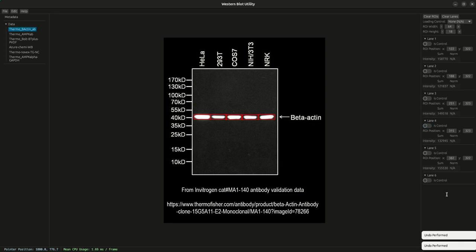And then just to demonstrate that you could right click, remove the lane, it will also remove the ROI. The lane is ultimately a parent for the ROI. So if you remove the lane, it will also remove the ROI. And in this case, that is ultimately what we want to do.